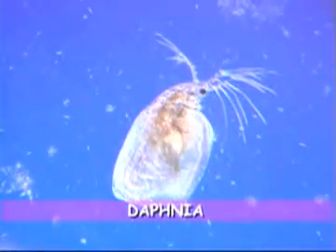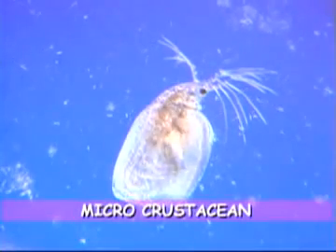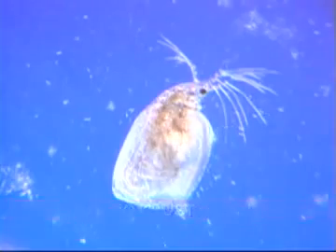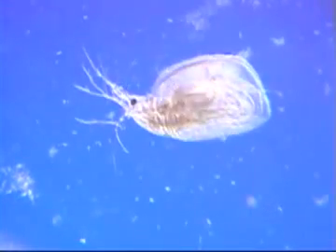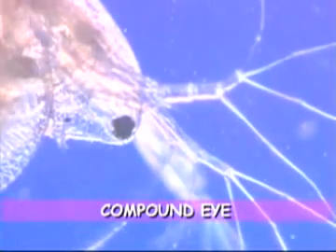The Daphnia is another multicellular animal. It is considered a microcrustacean and is distantly related to shrimp, crabs, and lobsters. It moves by flicking its pair of large antennae. It has a single compound eye. While the eye is quite large, the Daphnia's vision is probably poor. It is near its back where you find its heart, which beats at 300 times a minute. Females are sometimes seen carrying as many as 40 eggs in their brood chamber.